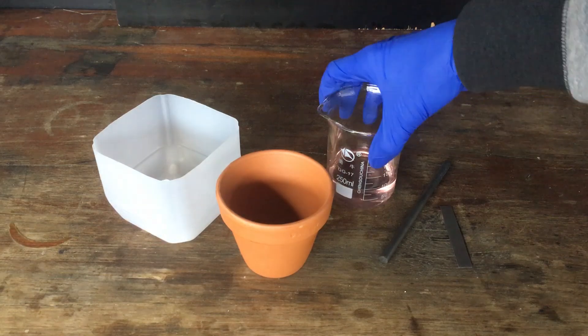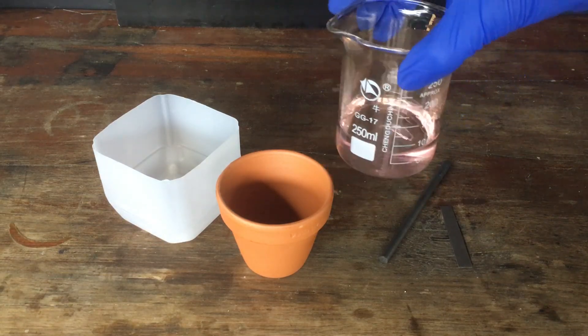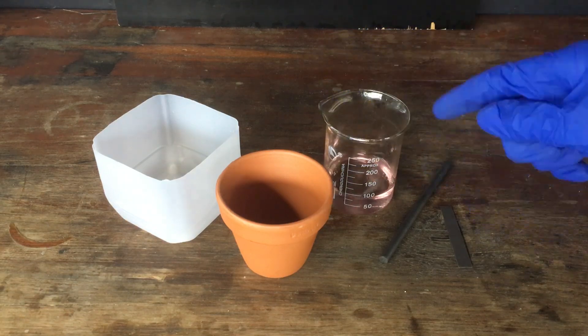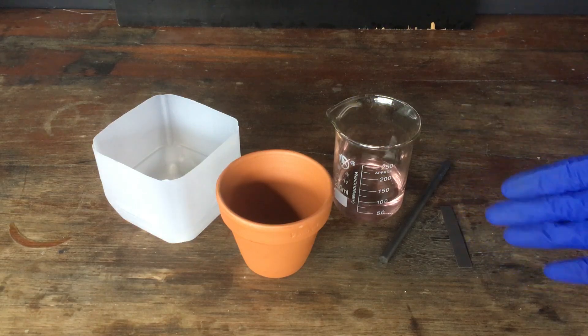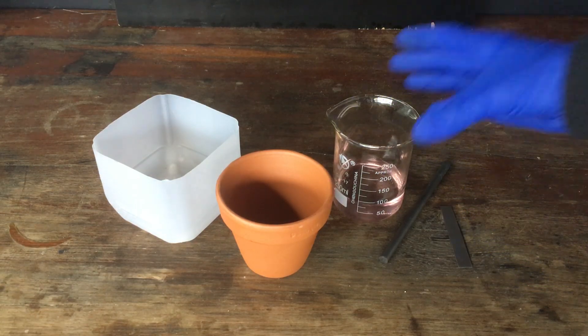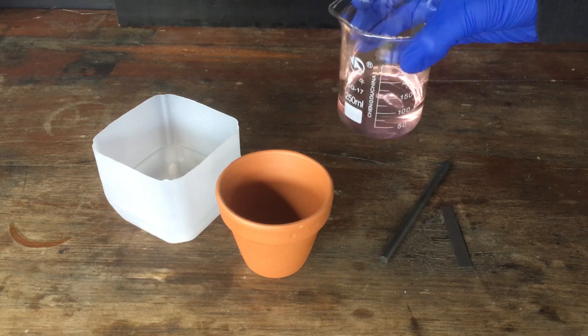Anyway, you can see what I've got here is around 100 milliliters of a manganese sulfate solution. I made this, extracted it, and purified it from all of my manganese waste, from the manganese chemistry that I've done over the past year. So this is actually quite pure and quite concentrated manganese sulfate solution.